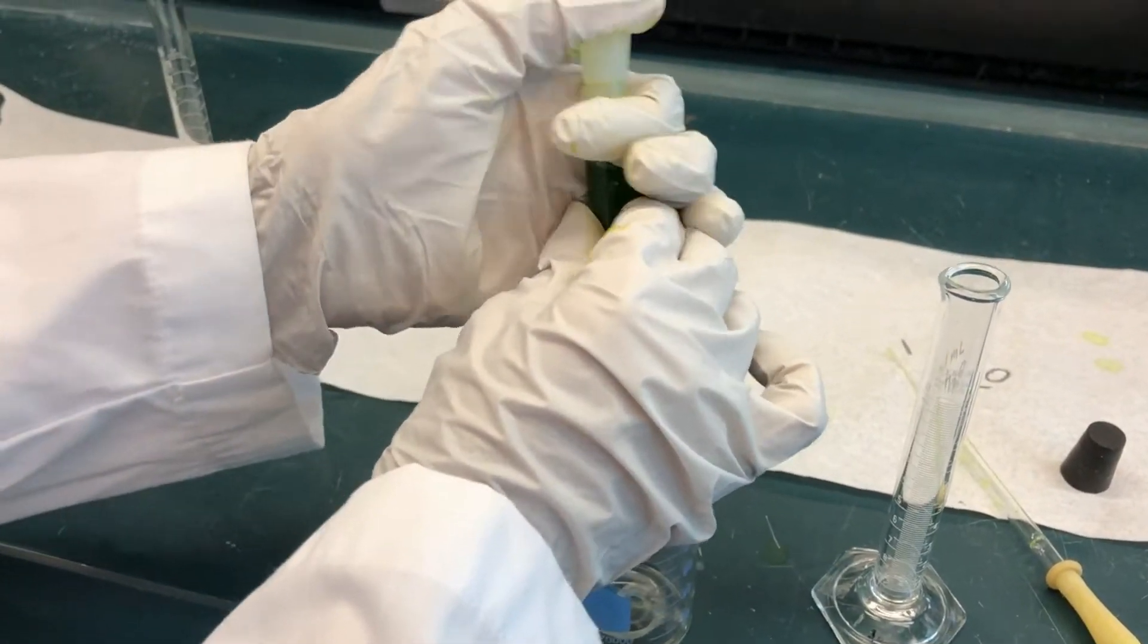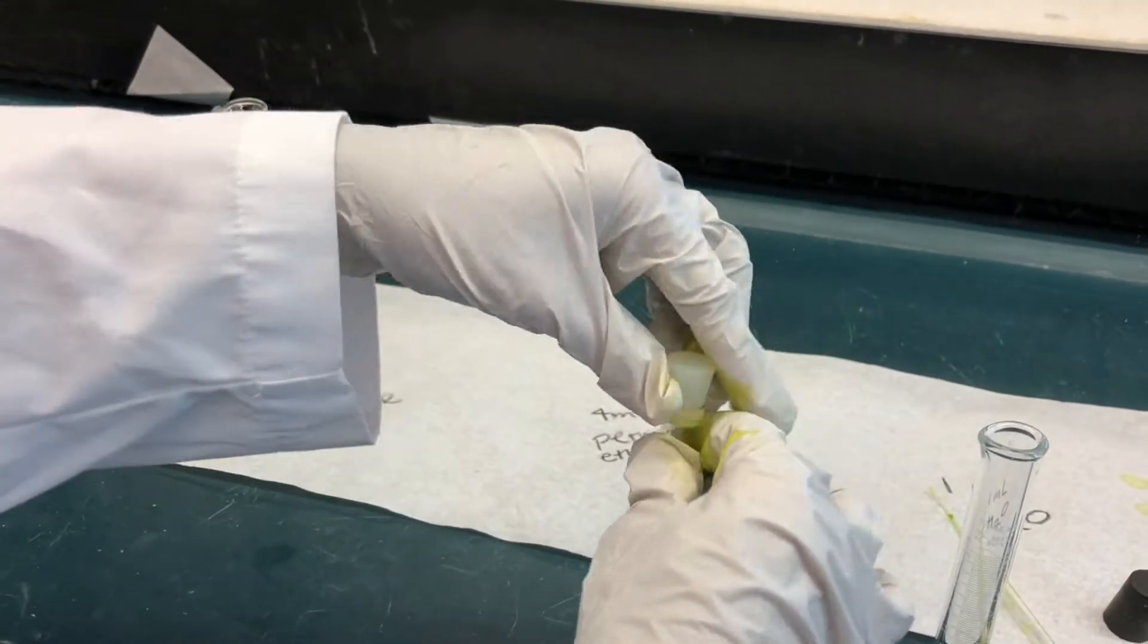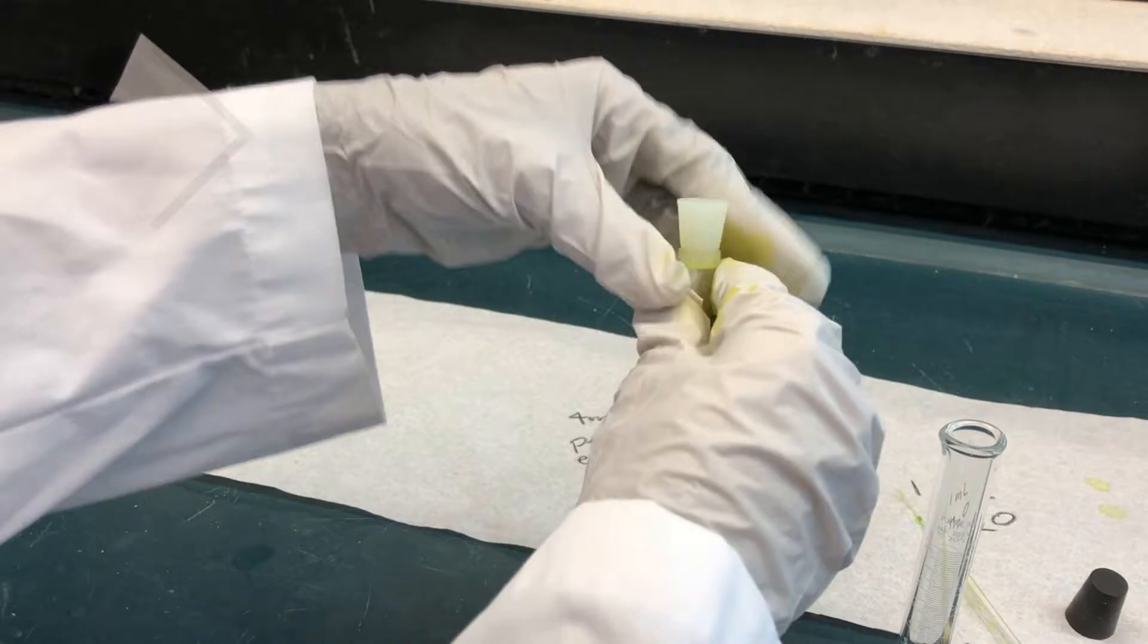The stopper tends to pop out at this step so hold it tightly with your thumb while shaking, and occasionally remove the stopper to release pressure.